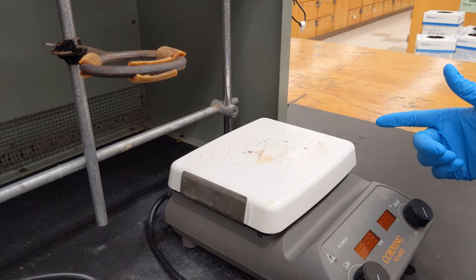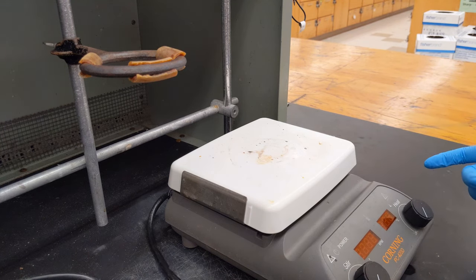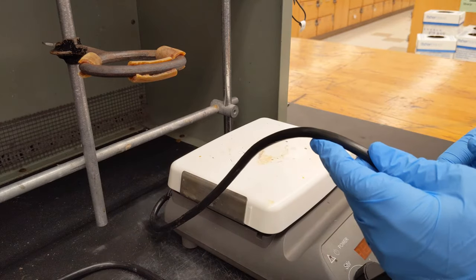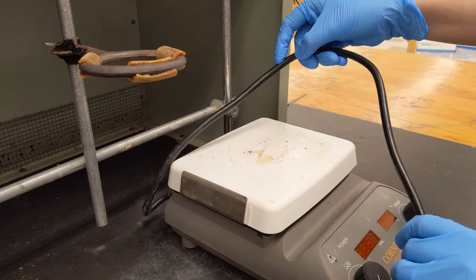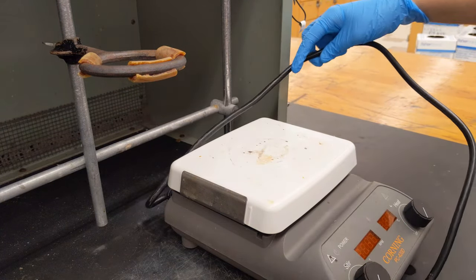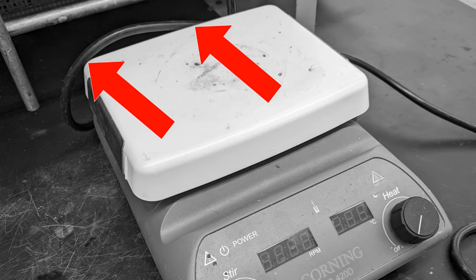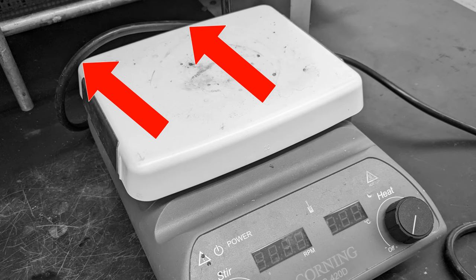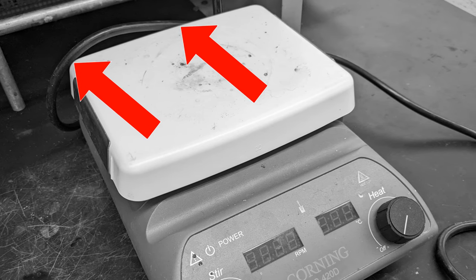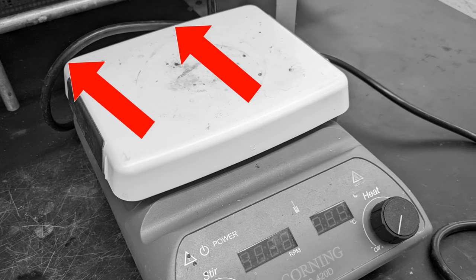The most common mistake I see is people not paying attention to where this power cord is. So right now this is off and cool, but it is entirely possible to have this cord in a bad location such that it's likely to get burnt. Do not do that. So plug it in and look at where your cord is.